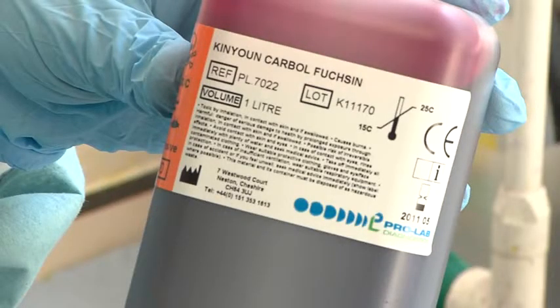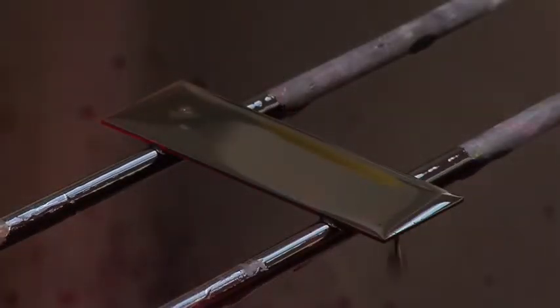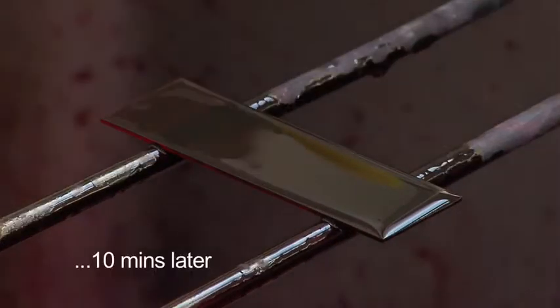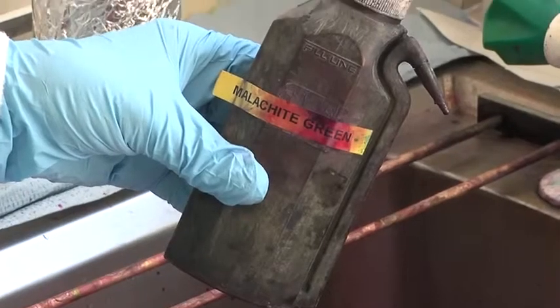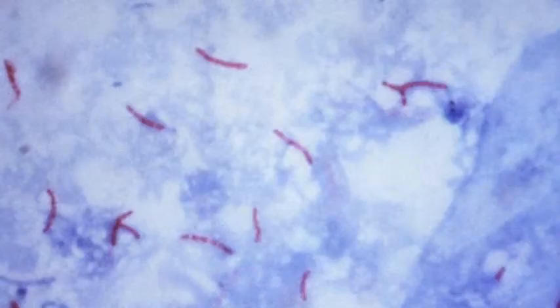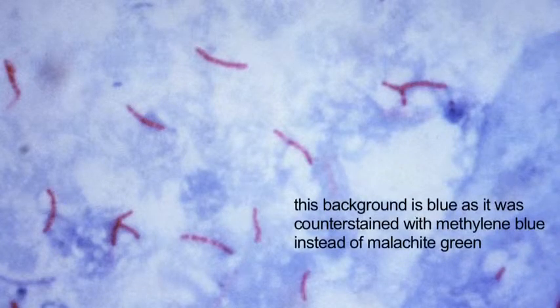An alternative stain is the Kinyoun cold ZN stain, which uses Kinyoun's carbolfuchsin for 10 minutes, which has a high concentration of phenol in it, and it does not require heating as you would need to do for a regular ZN stain. After the carbolfuchsin, 3% acid alcohol is added for 5 minutes, and then counterstained with malachite green for 30 seconds. Acid alcohol fast bacilli appear as red rods against a green background when viewed using oil immersion at ×1000 magnification.